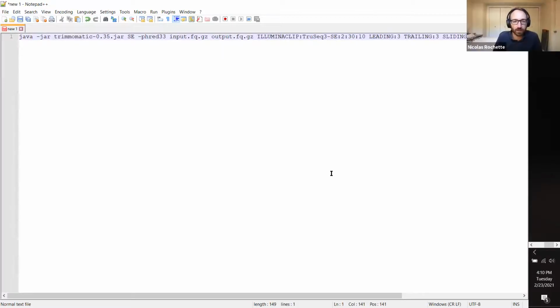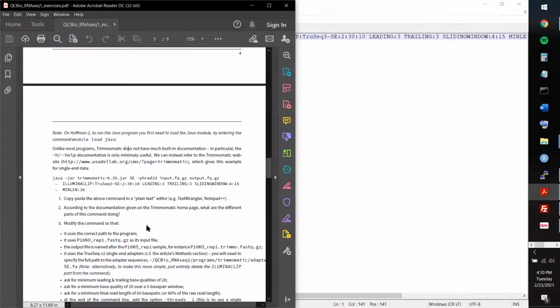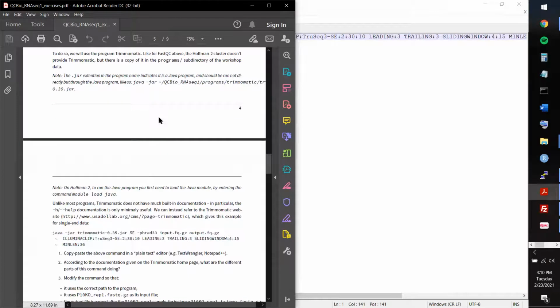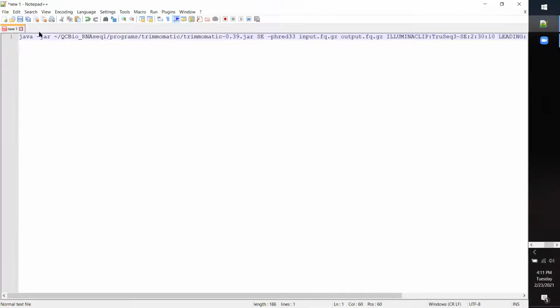Oh, when you copy paste, it's not? Okay. Yeah, I don't know. I'm on Windows. Maybe something about how I copied it, but when I copied it directly from this PDF, it had two new lines, and that kind of messed me up initially. And then I had to change all these things that you included here. So the correct path to the program has to include this here. So I copied this and replaced this command with the proper thing. And again, that kind of breaks it into two lines, so I had to put it back together there.